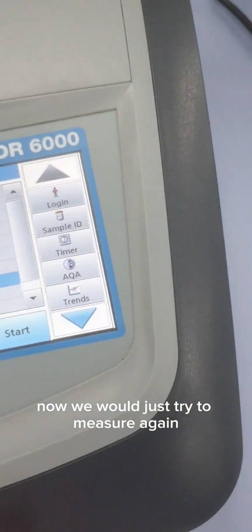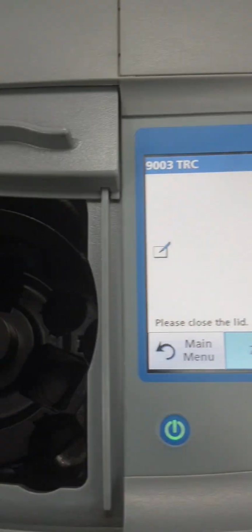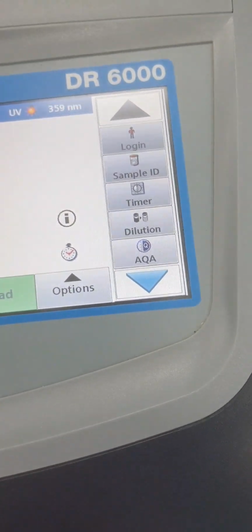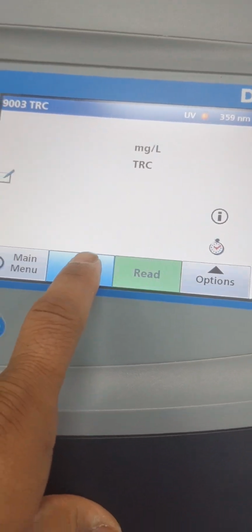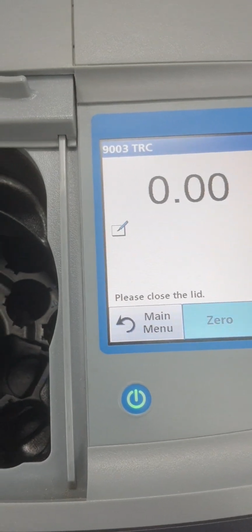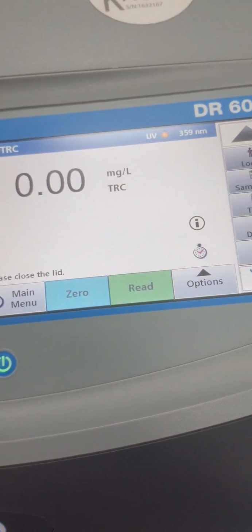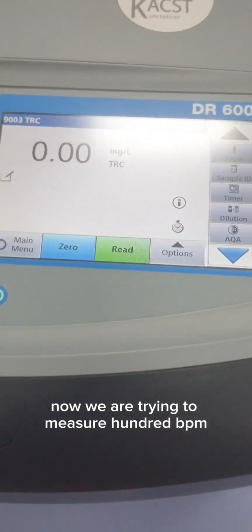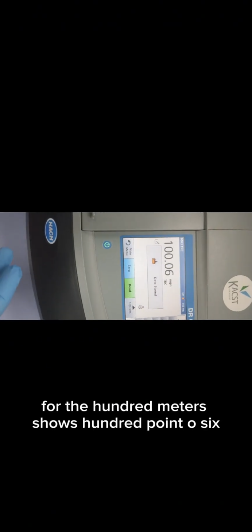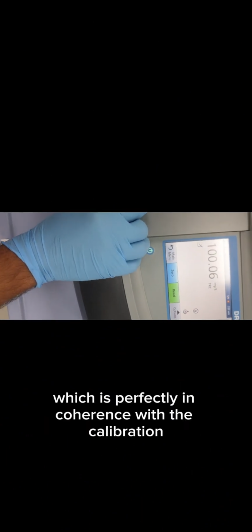Now we would just try to measure again. This is our 0. Now we are trying to measure 100 ppm. Sorry, this is 75 ppm, so it's 78.90. 100 ppm shows 100.06, which is perfectly in coherence with the calibration that we created for the tetracycline. That's all for the tetracycline.